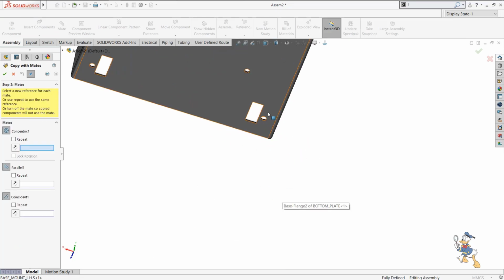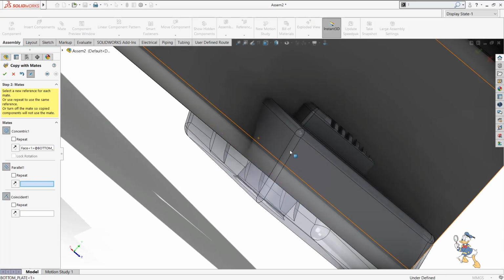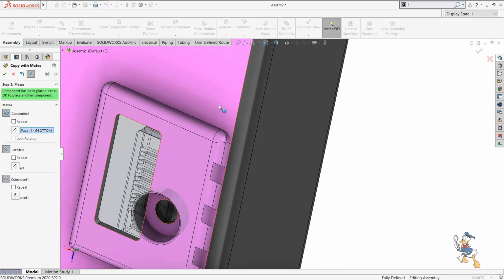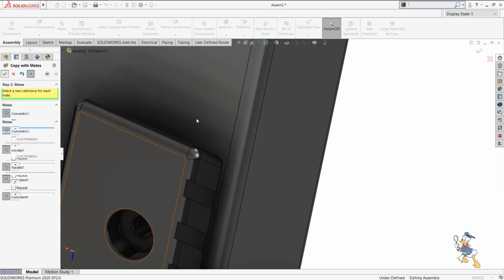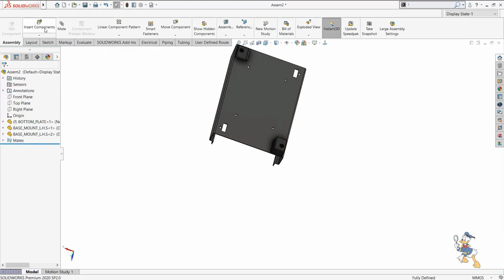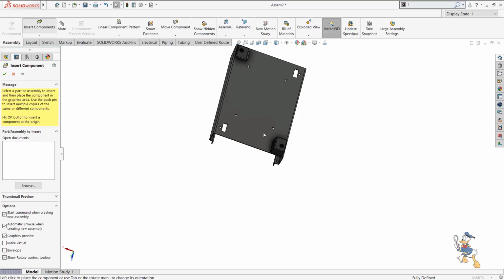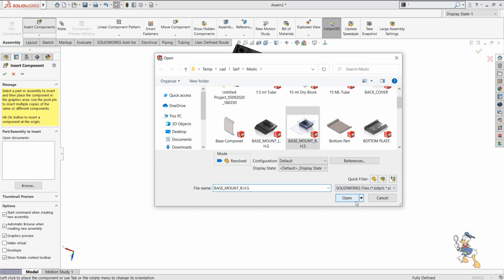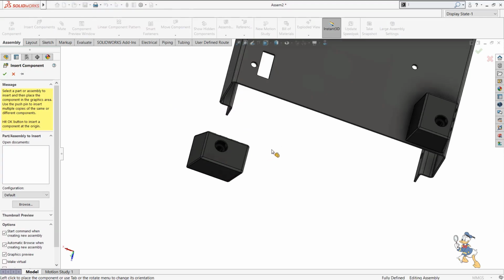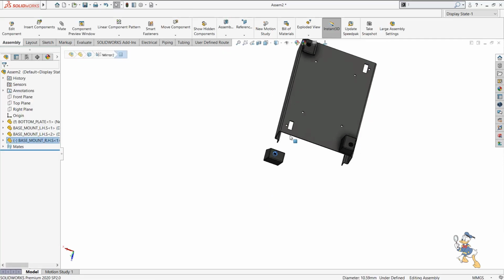We can copy the components by just providing the value in the features, and then it places them automatically. We don't need to select a feature again and place it again over there. I can copy those components if we have the same mate value. So now we just need to provide some more material to the assembly and place some other kind of base mount which is required for these holes.